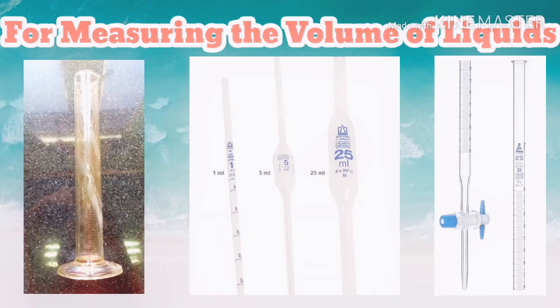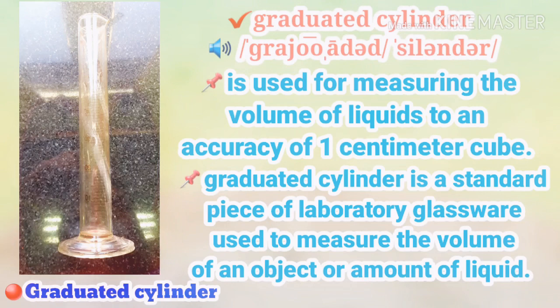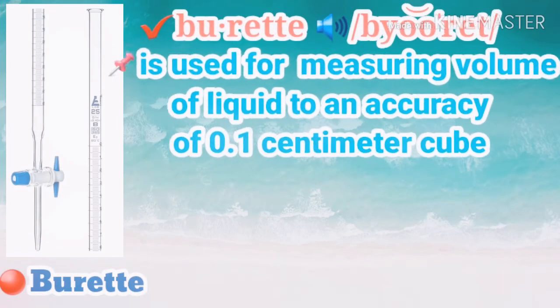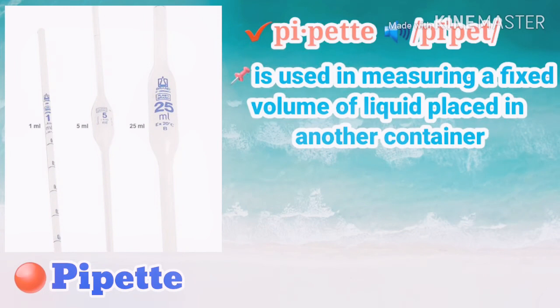Here are some apparatus for measuring the volume of liquid. Number one, we have a graduated cylinder — it is used for measuring the volume of liquids. We also have a buret and a pipet.